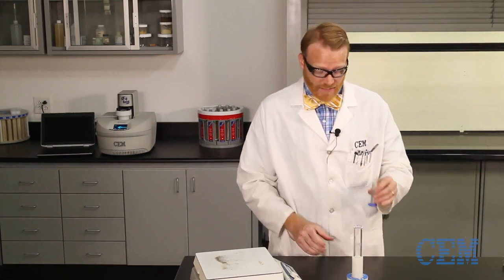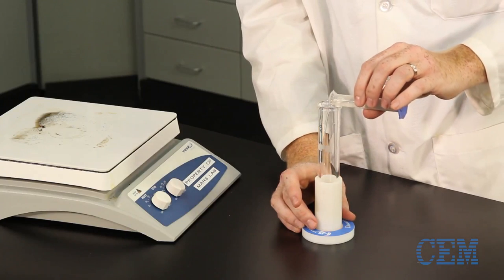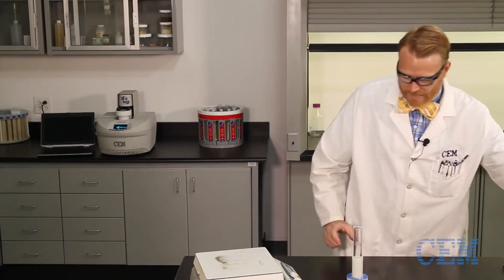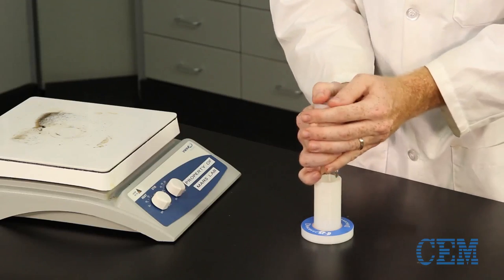We're going to add 10 ml of our acid and cap it. Now we're ready to go to the microwave.